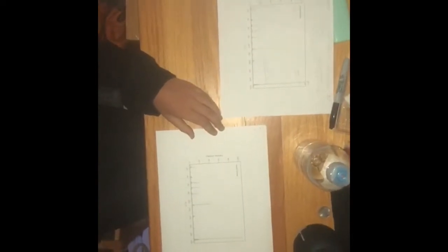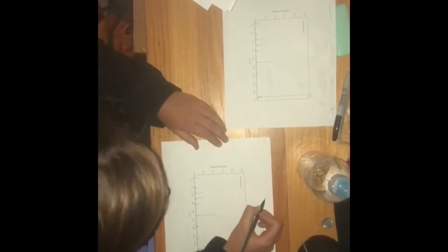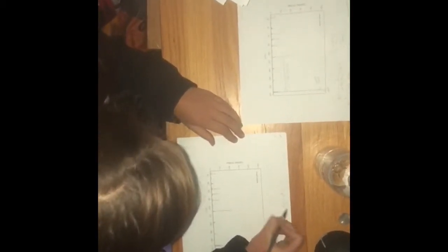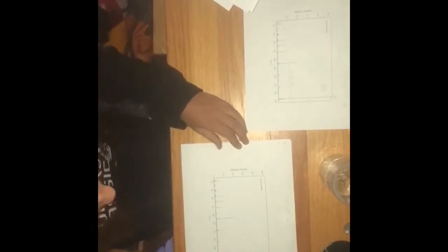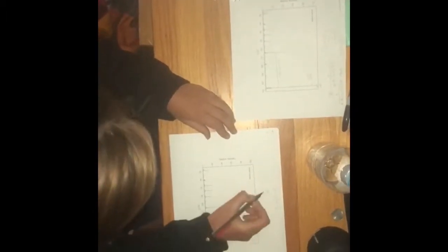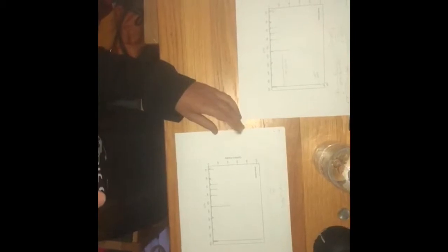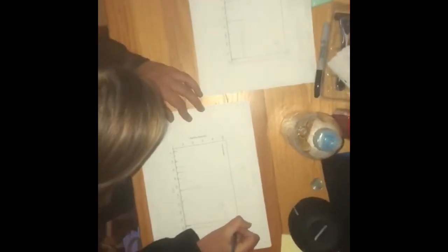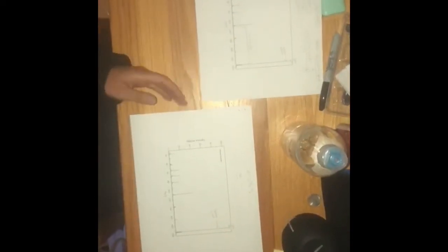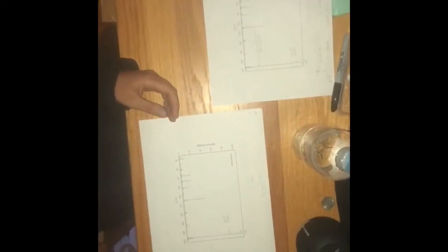Okay. So we'll begin with the molecular formula, which is C8H10N4O2, and this is for caffeine, and its molar mass is 194. So that'll be important whenever figuring out your M plus peak. Since it's the tallest peak, it's the base peak, and it's also the M plus peak because it's at 194, which is the molecular mass of the caffeine molecule.